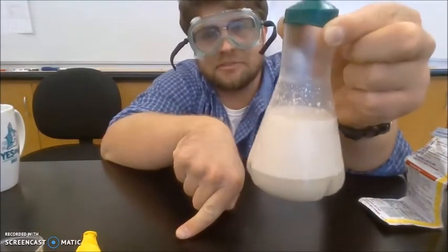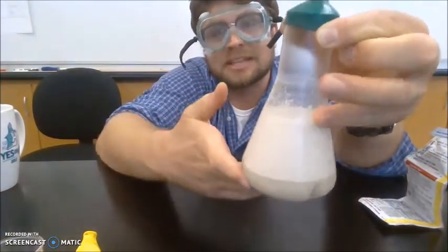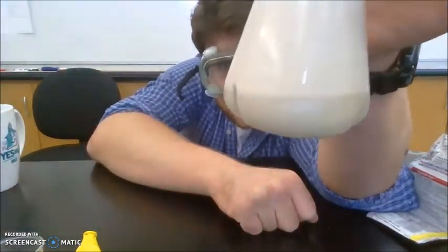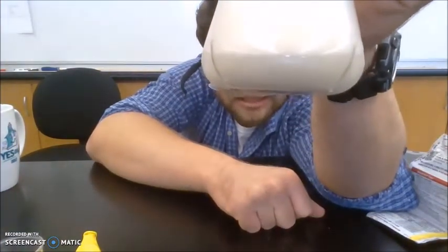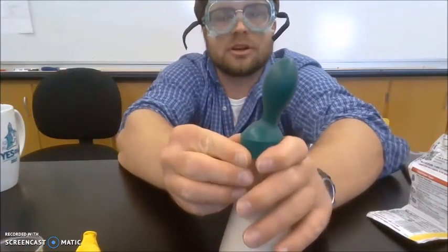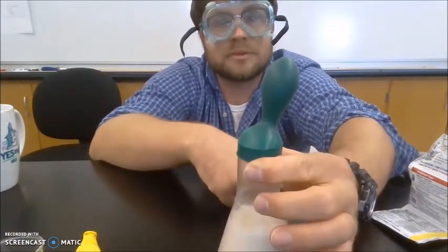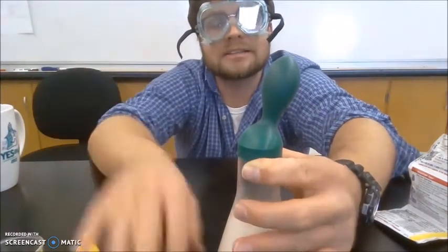And you can see that the foam is increasing, all that carbon dioxide gas being trapped in water and sugar and making this little foamy, gassy matrix. The yeast in the water is fermenting away, breaking down that table sugar into carbon dioxide gas and alcohol and energy. And I want to try to hold on so you can really see it going now. Yeah, so it's fermentation. This process right here is the same process that makes bread rise in the oven.